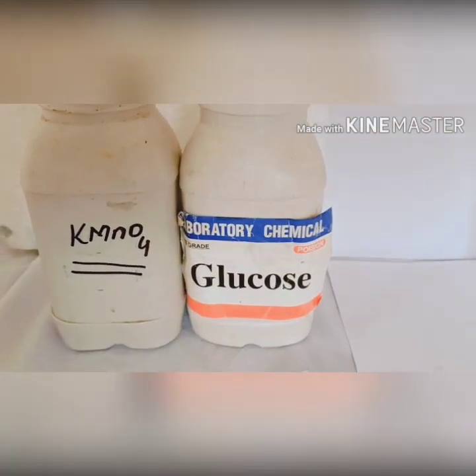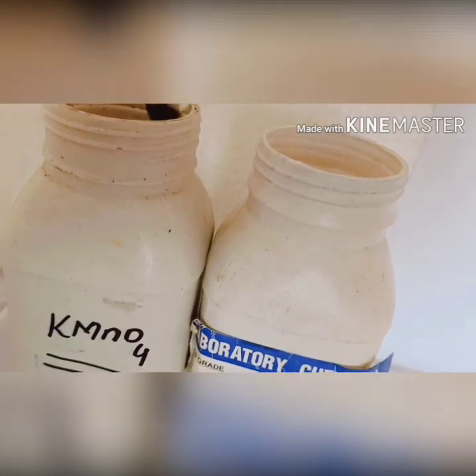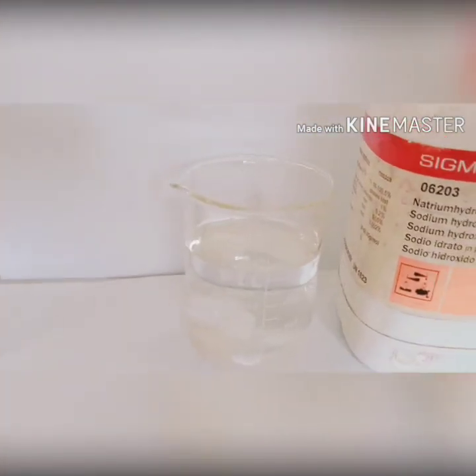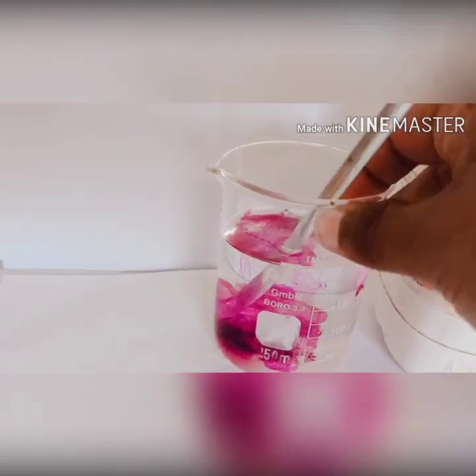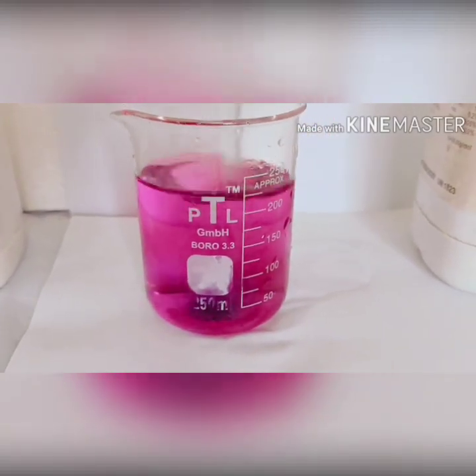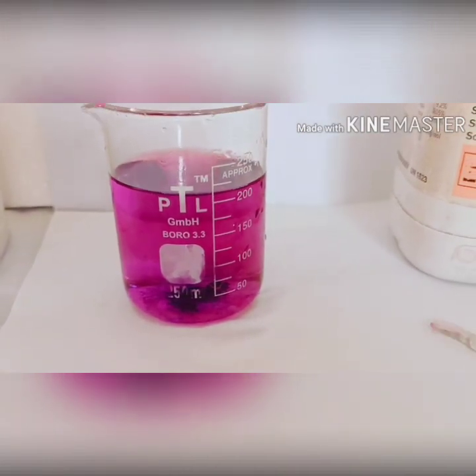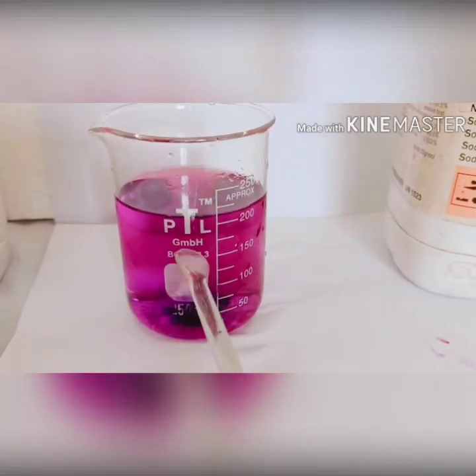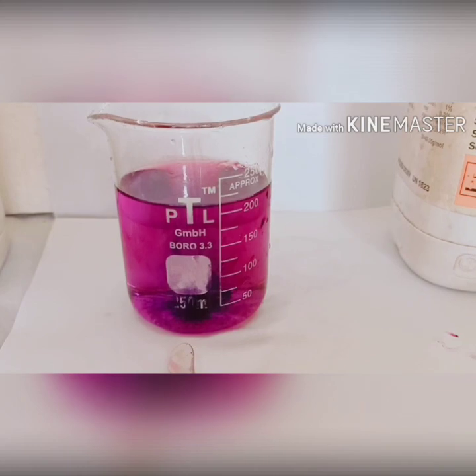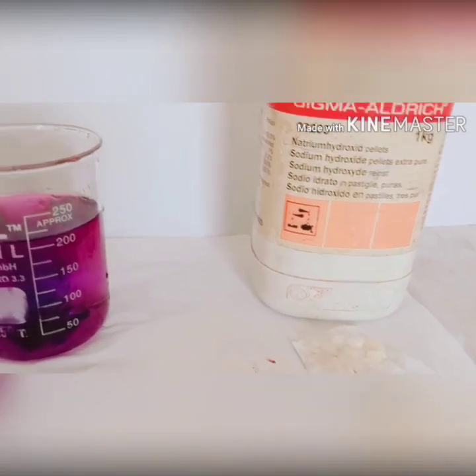We take a small amount of water in the beaker. First, we take some crystals of potassium permanganate, which are purple in color, and we put these small crystals into the water. You can see that when we put the crystals of potassium permanganate, the color of the water becomes purple — a pink or purple color. This purple color indicates that the oxidation state of manganese is positive seven, which is stable.